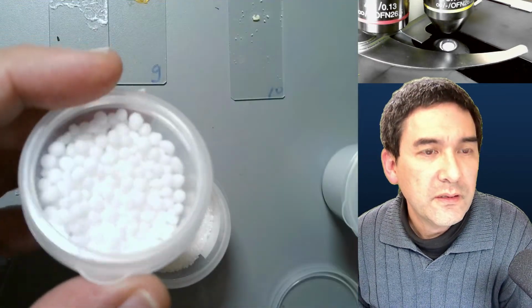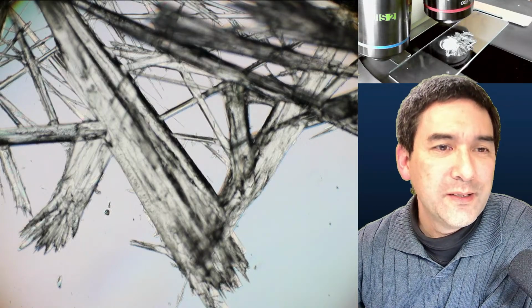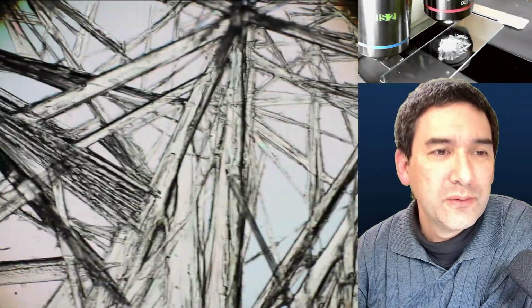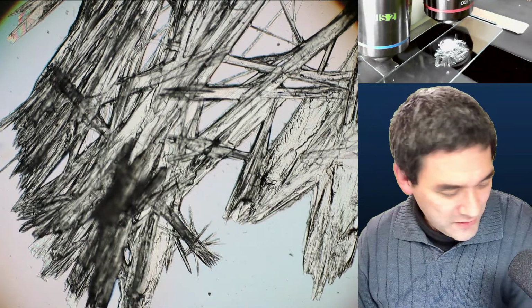Okay. Urea. It comes in little pellets like this. It also dissolves very well, and was very easy to crystallize. So the urea crystals were formed quite easily, and the urea crystals look like this. Okay, and again, let's get a better overview here, at low magnification. Thin thread-like structures. It was actually interesting. At the beginning, they did not form, and then all of a sudden they formed very quickly. So they were also waiting for some crystallization starting point, and then they formed very rapidly, but at the beginning not so.